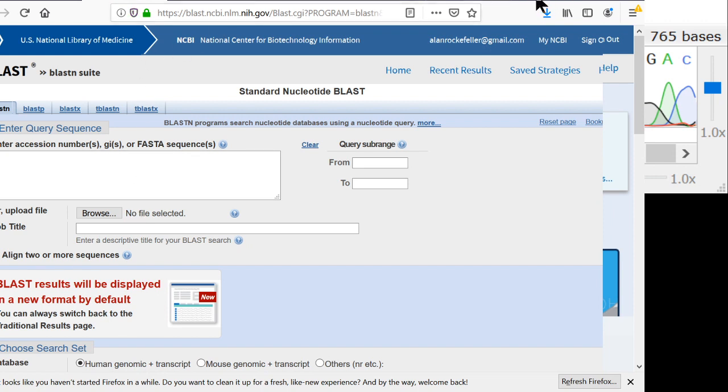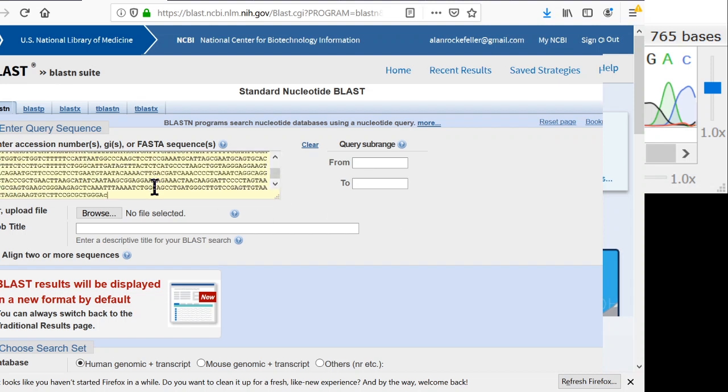So here's the query box. A little bit is cut off on the left, I can see, but I think that's fine. It doesn't really matter. I just pasted the DNA that came from the chromatogram right in there. So that's about 790 characters or so.